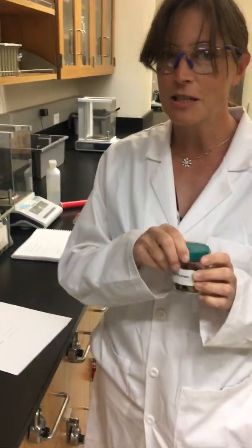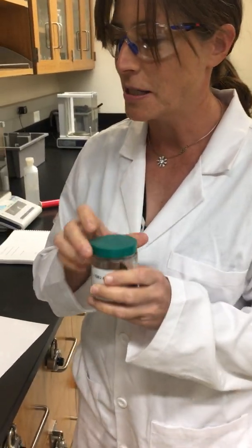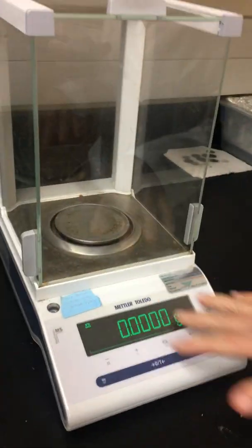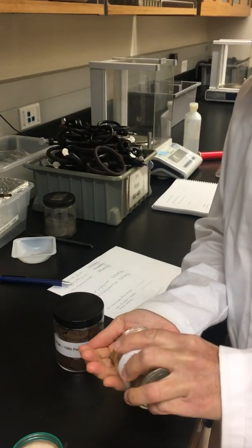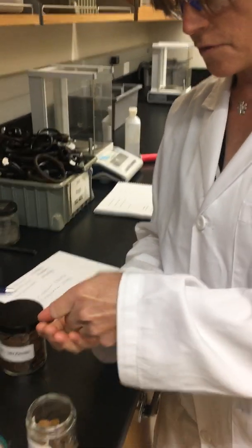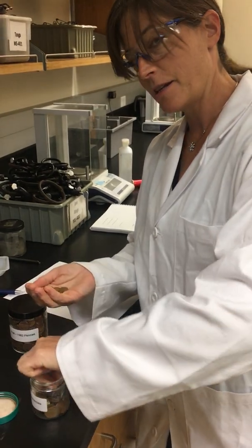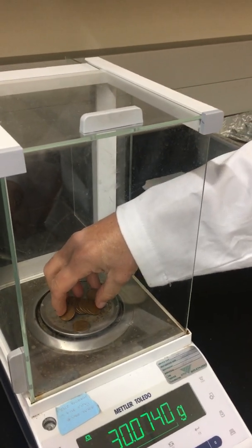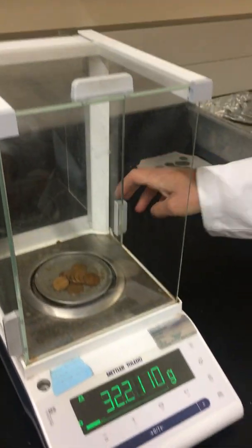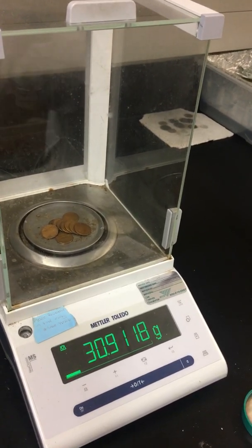The first part we need to do is take the mass of 10 pre-1982 pennies. We'll make sure our balance is zeroed out. Now we're going to count out 10 pennies: 1, 2, 3, 4, 5, 6, 7, 8, 9, 10 pennies. We'll add these to our balance. Our mass is 30.9118 grams.